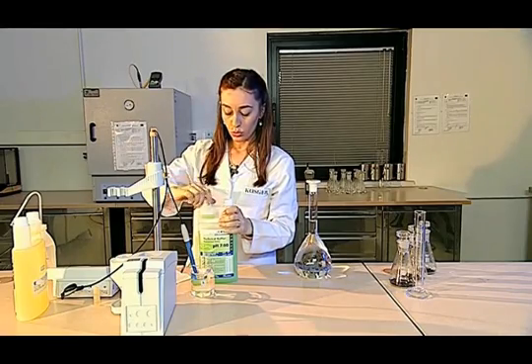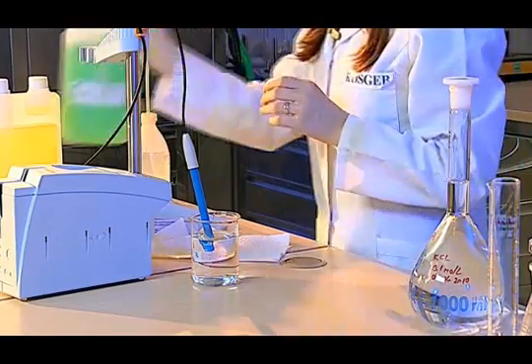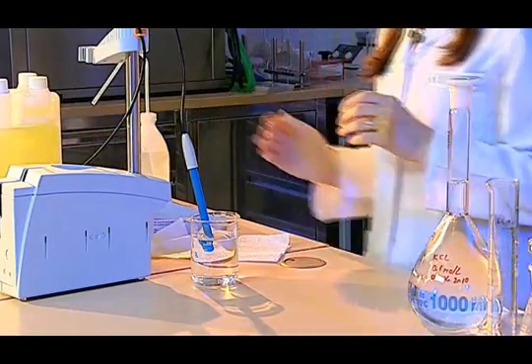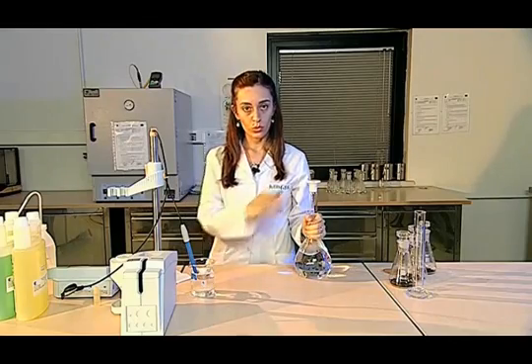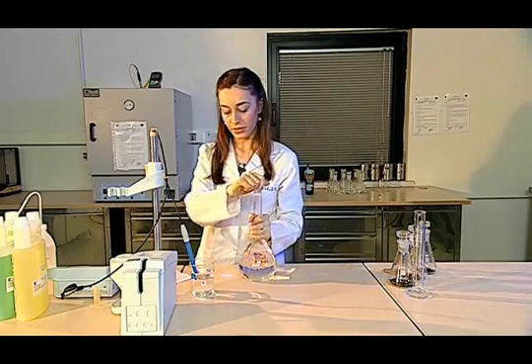When the test is not in progress, that is, when the pH meter is off, the electrode tip of the pH meter is kept in the potassium chloride solution.